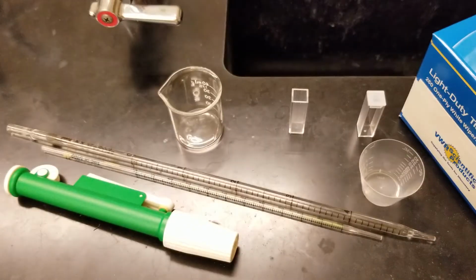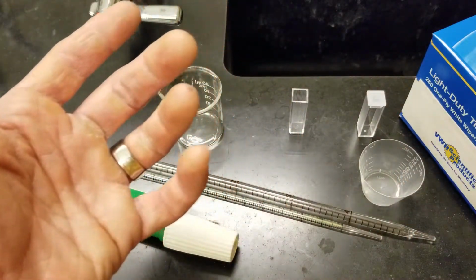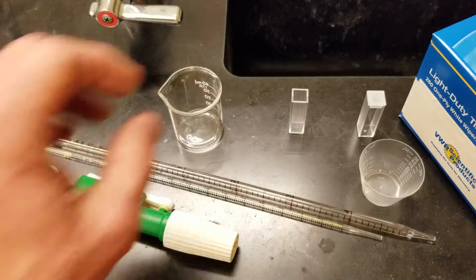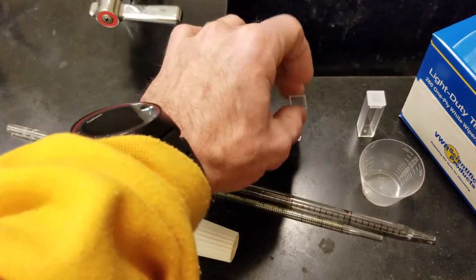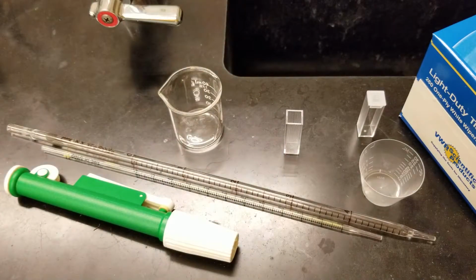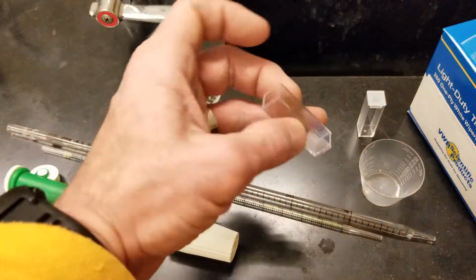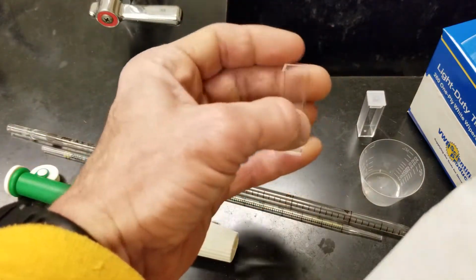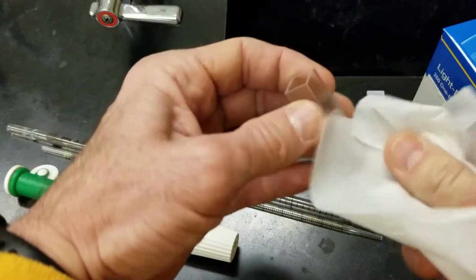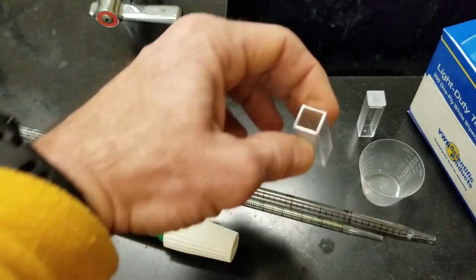Now notice you've got 2 cuvettes. One, use for your DI water for establishing your control, for zeroing your spectrophotometer, and then the other one is for your reagent. When in doubt, rinse it out. And I'm giving you chem wipes today because your fingerprints on the cuvette will mess with the absorbance. And so always keep your chem wipes around, wipe these off between each trial, between each zero.